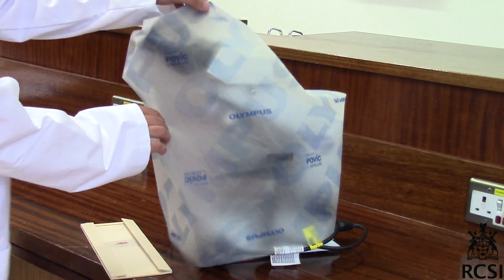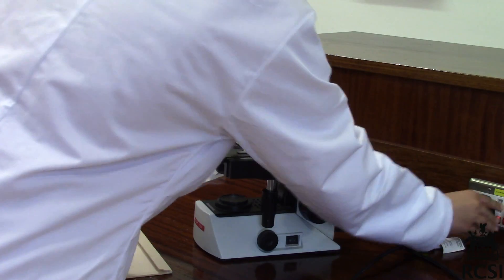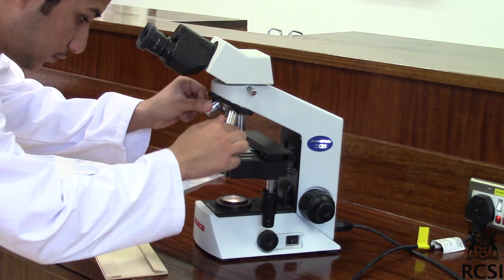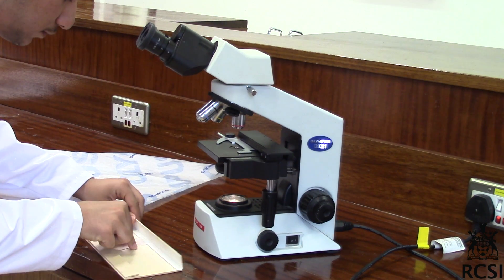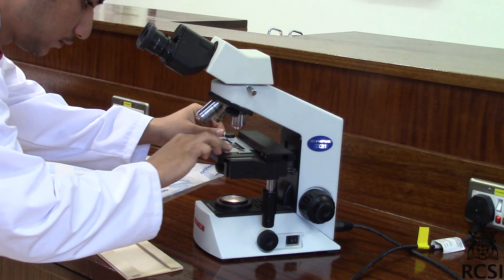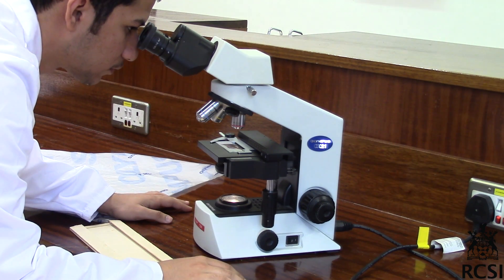To set up the microscope: remove the plastic bag, plug the microscope in, and turn on the light. Make sure that you use the low power objective lens first. Place the slide into the stage and use the slide holder, then look through the ocular lens.